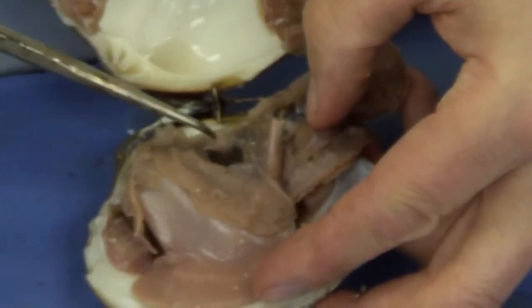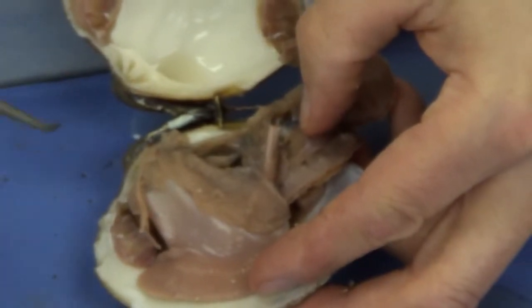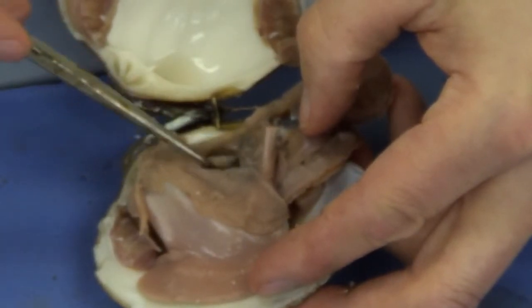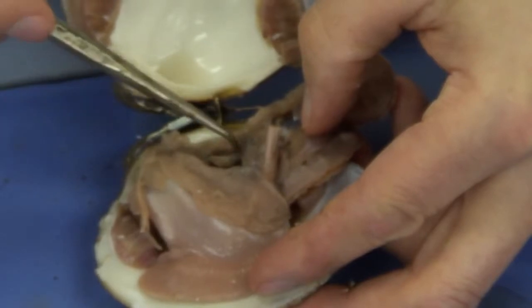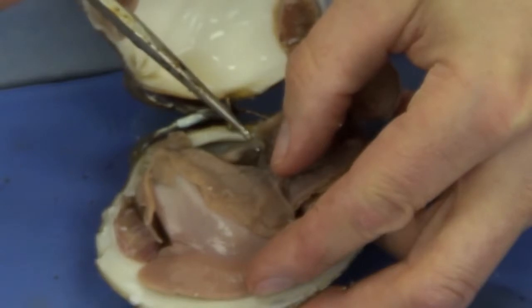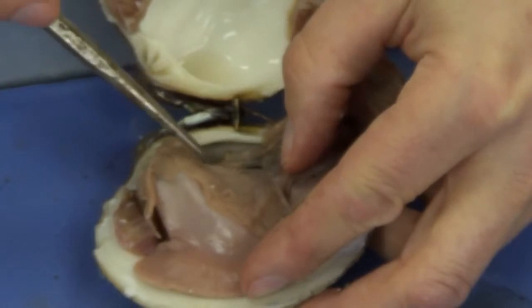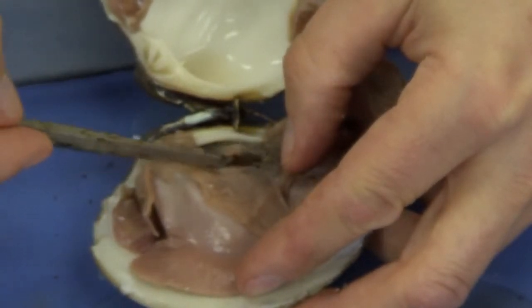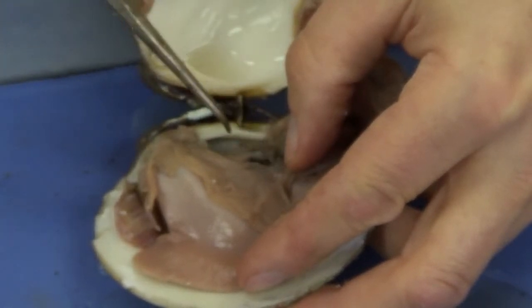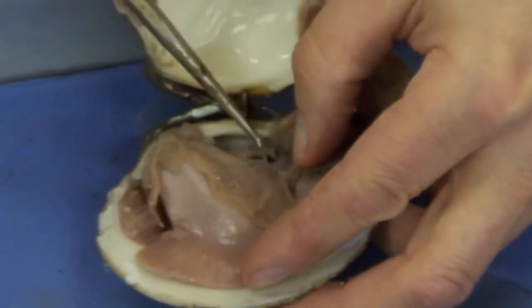This structure is the heart. And surrounding it is the pericardial cavity. Peri means around, cavity means space. So there's a space around the heart. And that's the heart right there. There it is. Now if I clean this up just a little bit, I see a tube. There it is. And it should be on the other side also. A thin dark tube. The thin dark tube is the intestine. Odd as it may seem, the intestine passes partly through the heart. So that is the intestine right there.